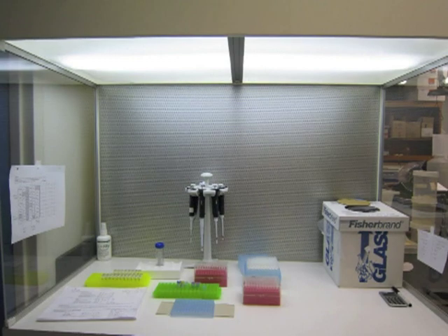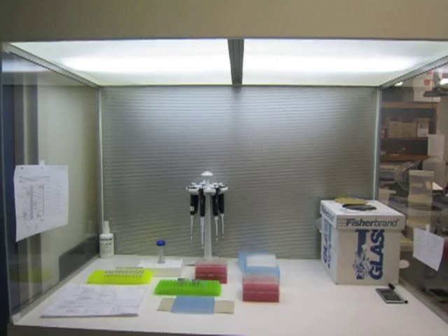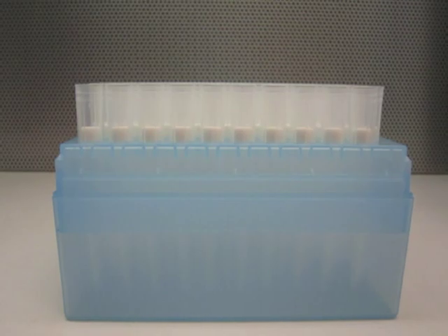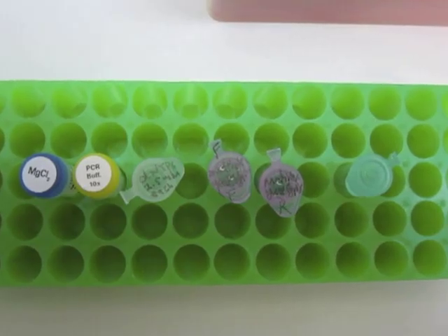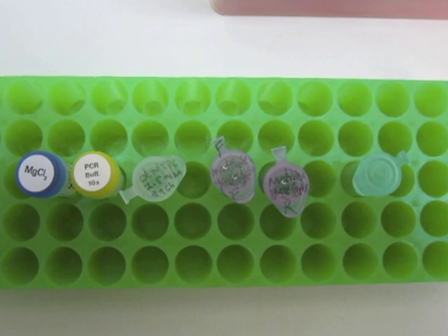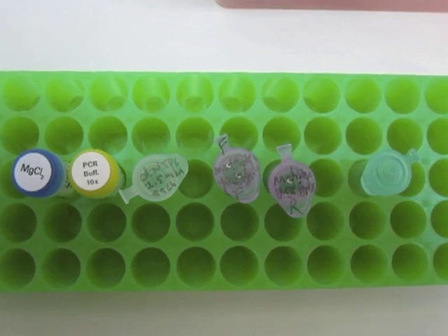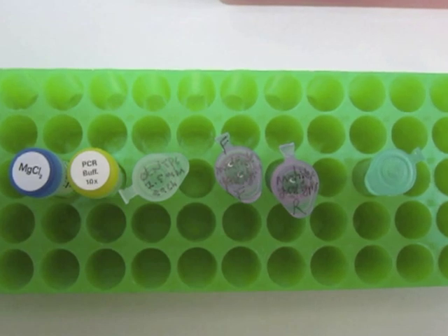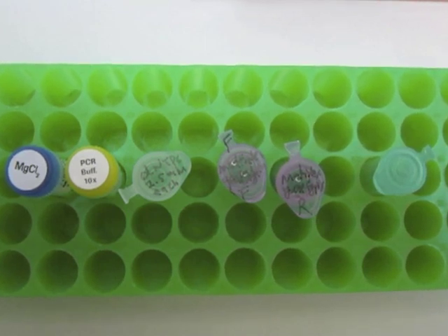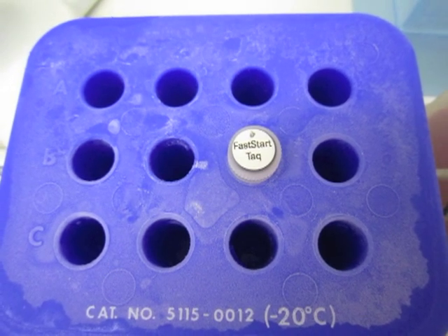Gather all your supplies and reagents at the PCR working station. Supplies include pipettes, filter tips, and a container to dispose of used pipette tips. Filter tips should be used for multiplex PCR to avoid contamination. Thaw all reagents at room temperature for 20 minutes. Reagents include DNA-grade water, 10x PCR buffer, dNTP mix, 25 millimolar magnesium chloride, and multiplex forward and reverse primers. It is recommended to not remove the fast start DNA polymerase from the -20°C freezer until time to add it to the master mix, or keep it in a cold block to prevent degradation of the enzyme.